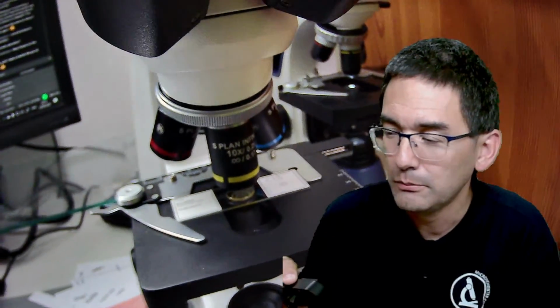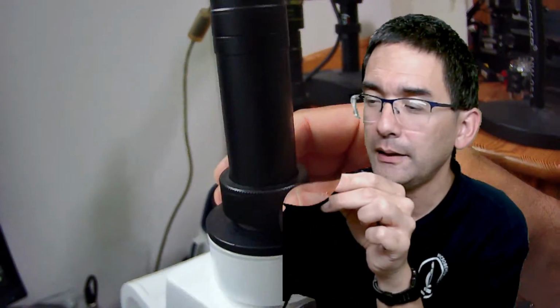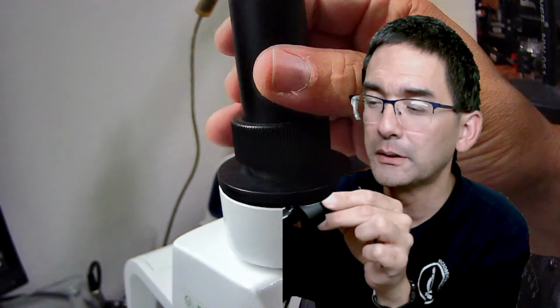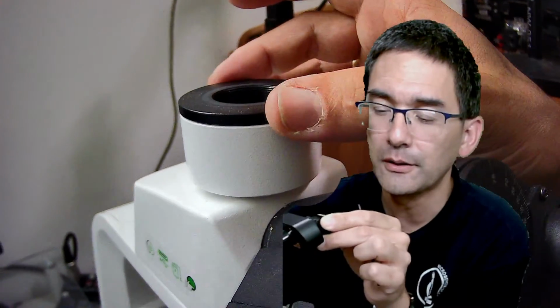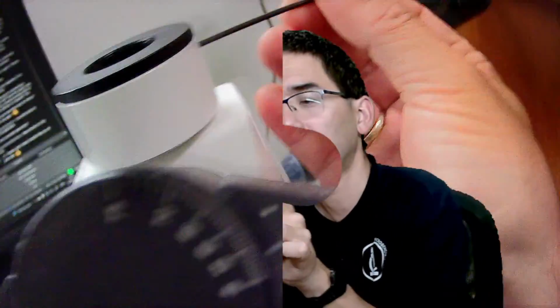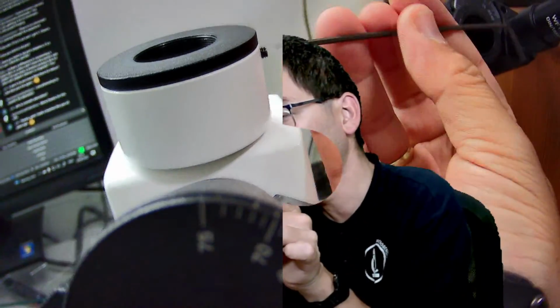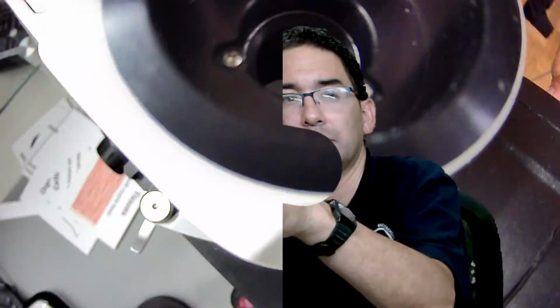So I'm going to show you very briefly again. I'm switching over to the webcam view, okay? And this is the microscope, the Swift Stellar 1. Just a standard microscope. Over here there is this tube on top, okay? And I was able to remove this tube, but there's something interesting here. You're also able to remove this part over here. Look, I'm going to take the tool over here, and I'm going to unscrew it a little bit. I'm going to remove this part here, okay? So it looks like this.